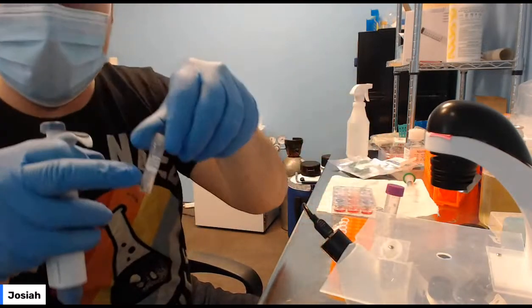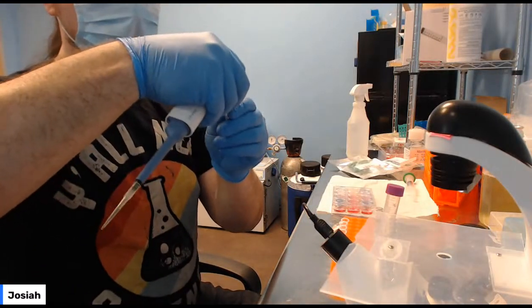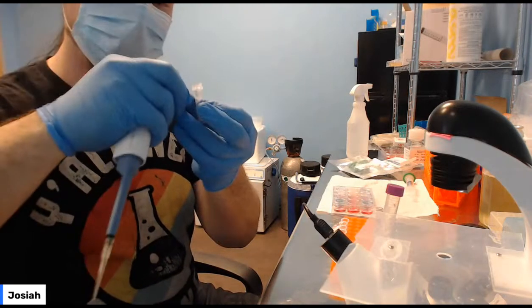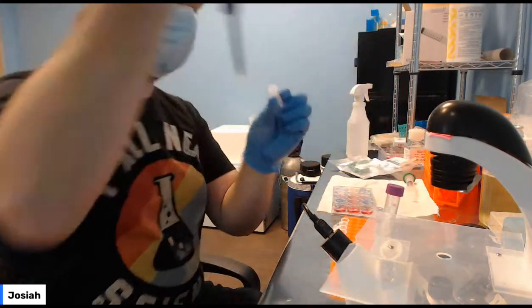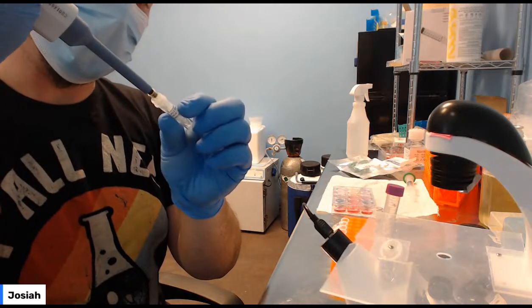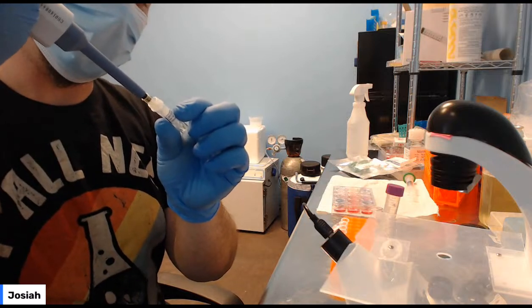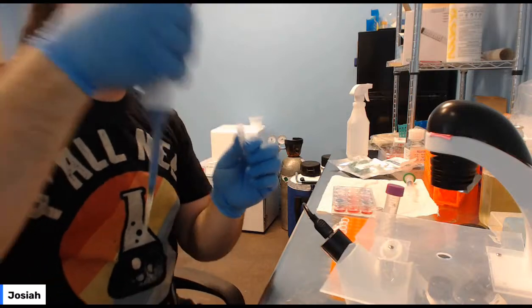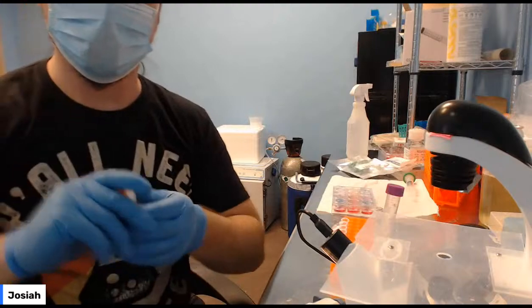Add it to the LAC-Z plasmid DNA. It says LAC-Z plasmid G418R. Add that. You can shake it or pipette it, but it should start to turn very slightly yellow. We add a yellow dye. DNA itself doesn't have a color, but we add a yellow dye to make it a little more visible, so you know when you've successfully dissolved it when we were freeze drying it. So you can shake it up, you can do whatever.